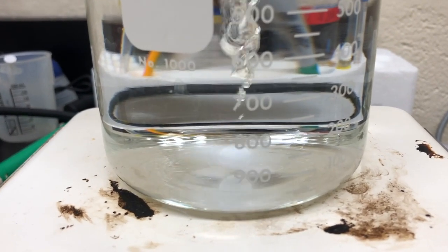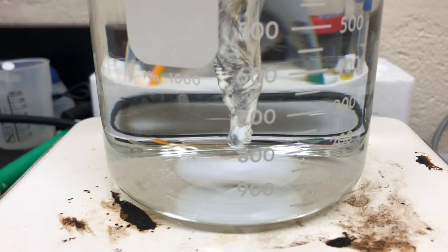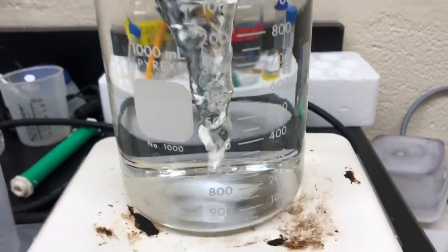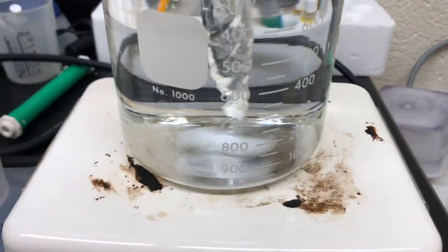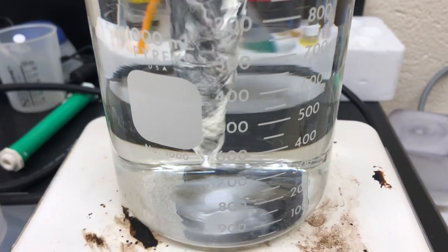And we can't just yet put it back into the graduated cylinder because there are still some particles that are not fully dissolved.